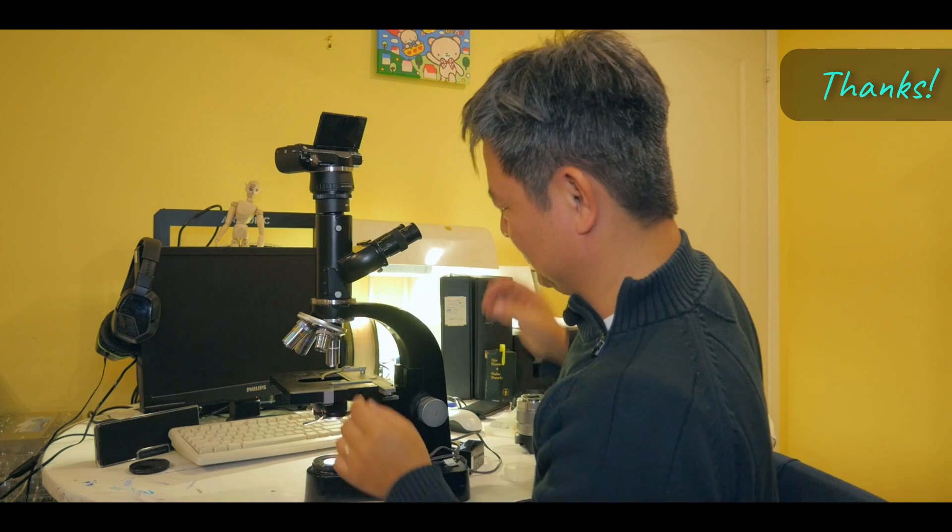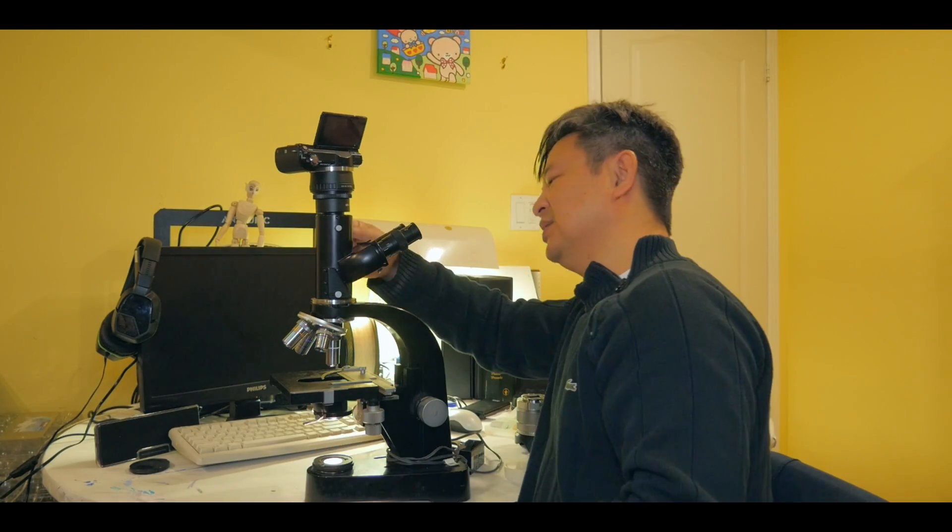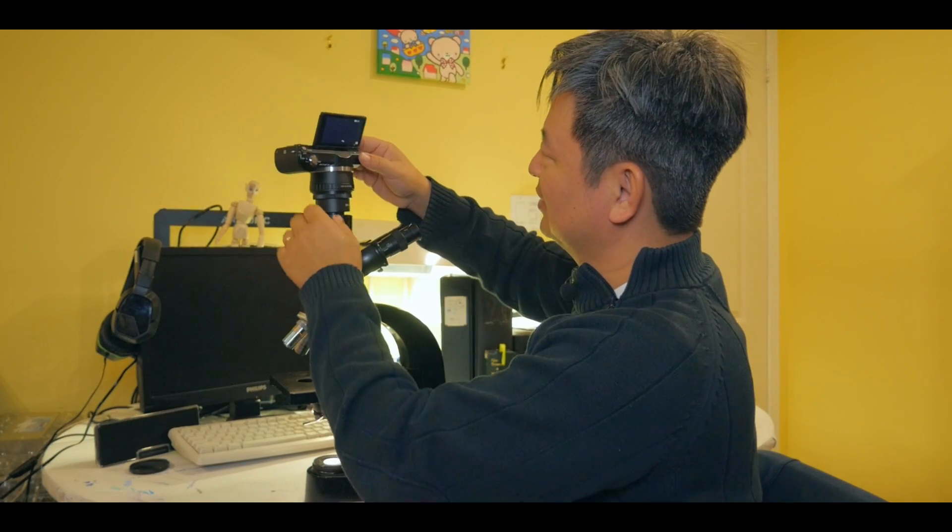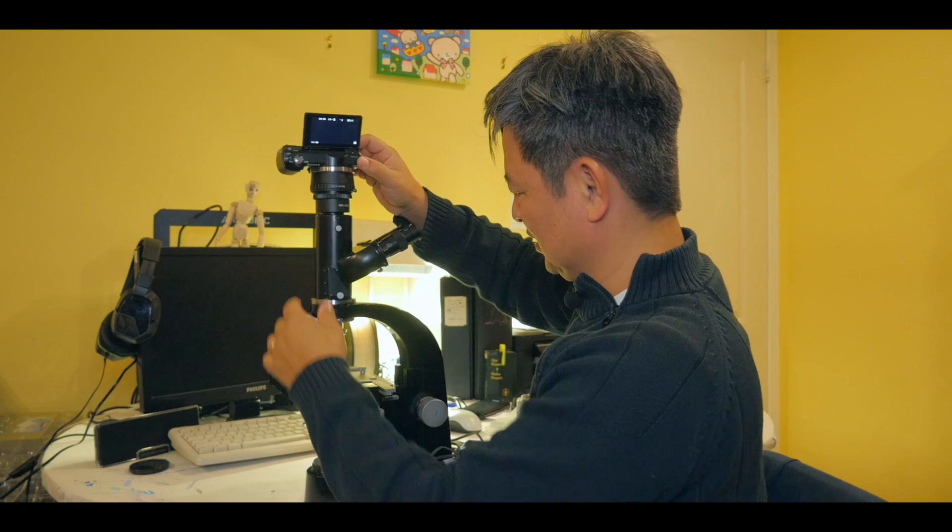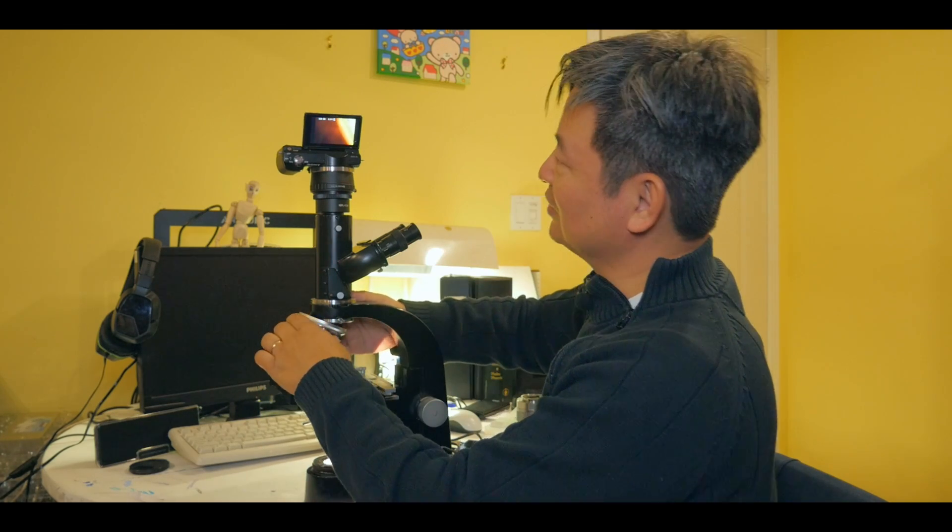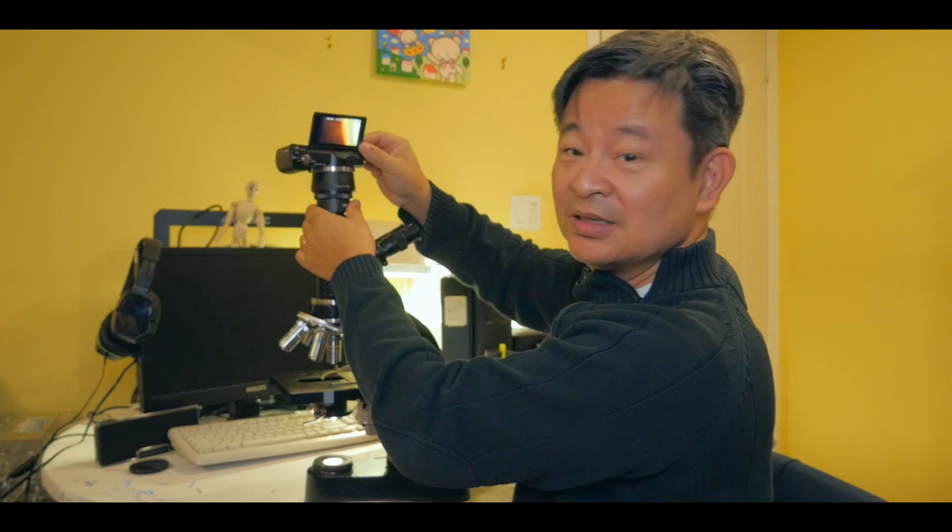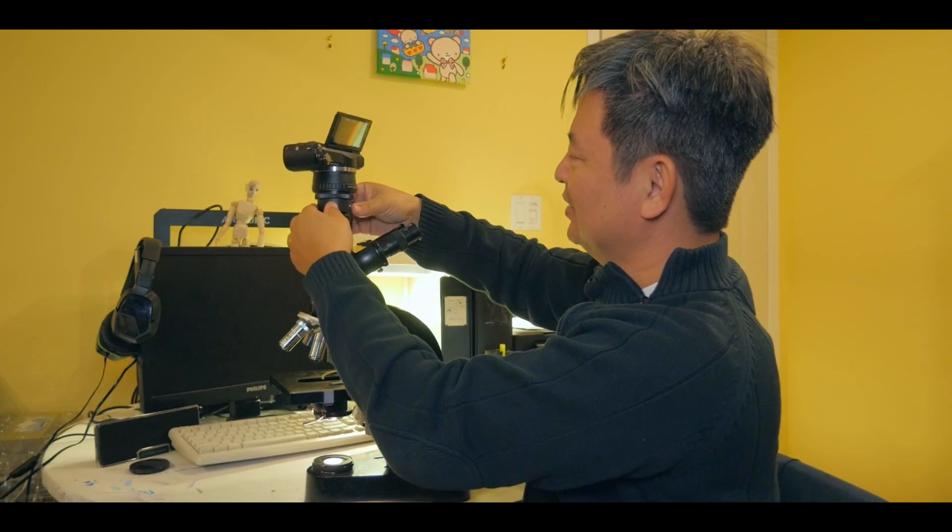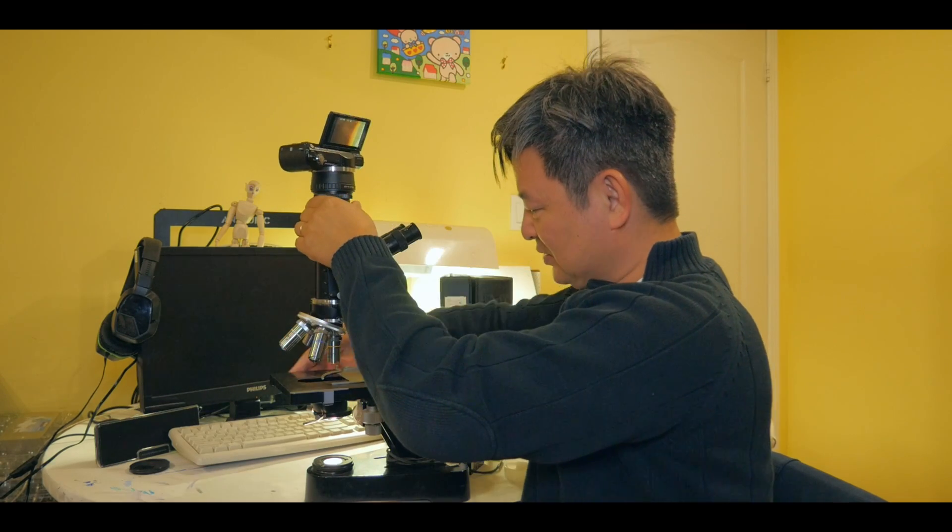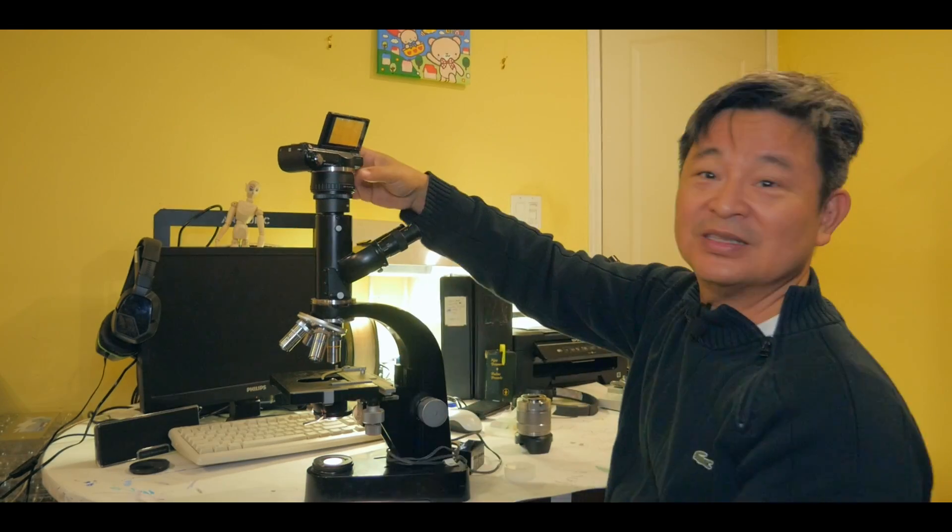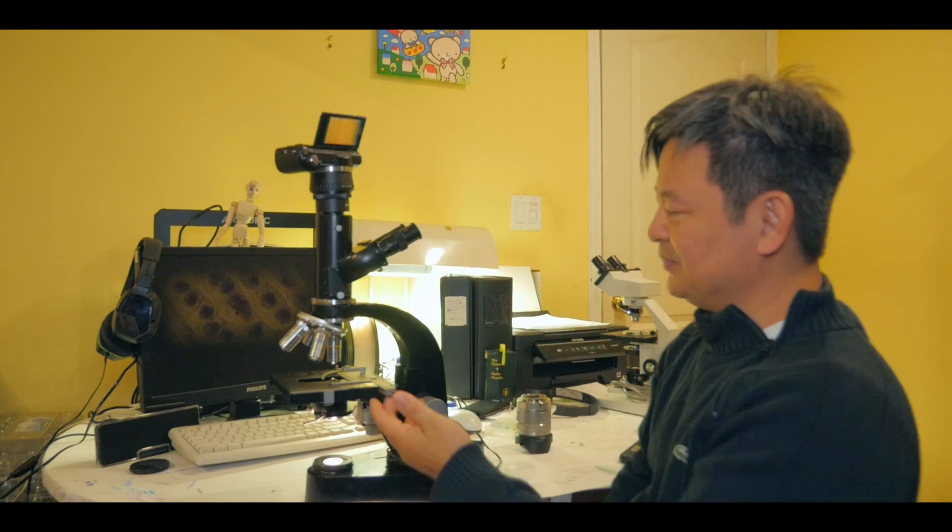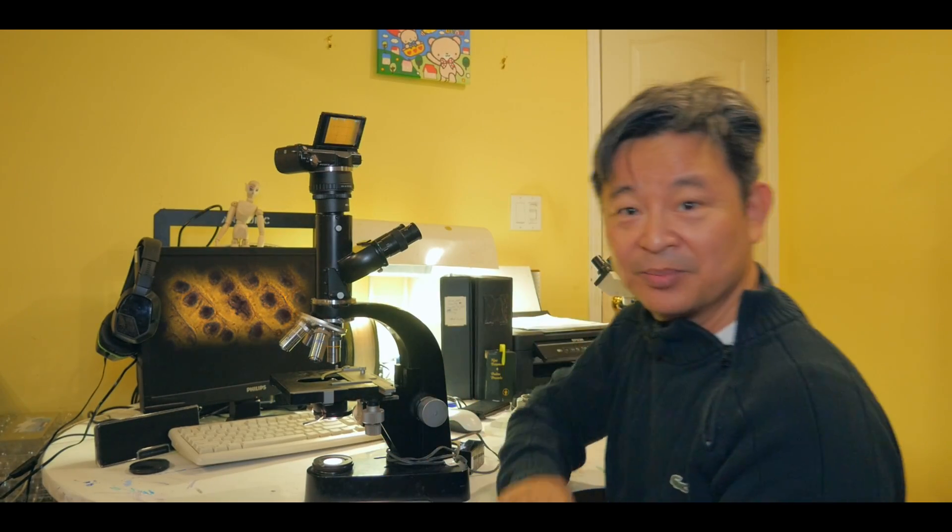So if I turn it on now, sometime you might have to put something there just to keep it steady there. Okay. And then you, then you have to swing this partition. Where is it? There we go. Let me turn on my camera and I should be able to see it. Let's see. There we go. You can see, and I can see the, yeah, you can see probably the image now, right? There we go. There. Okay. It's pretty cool. I just have to switch over. See, there we go. See, you can see that there's image coming to the camera on the top. So it's working pretty good.